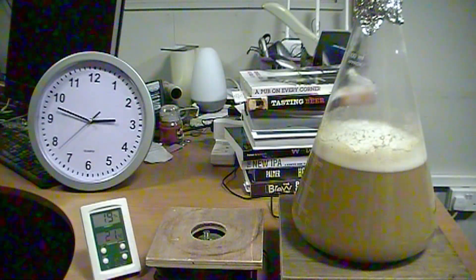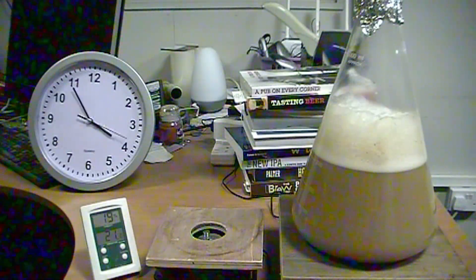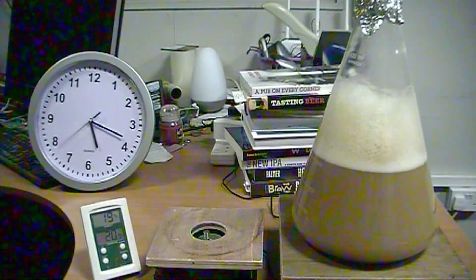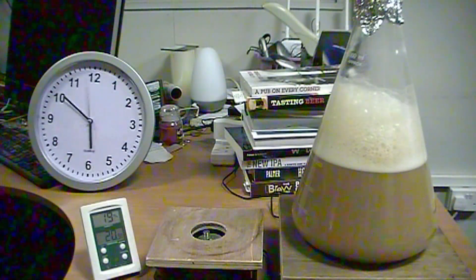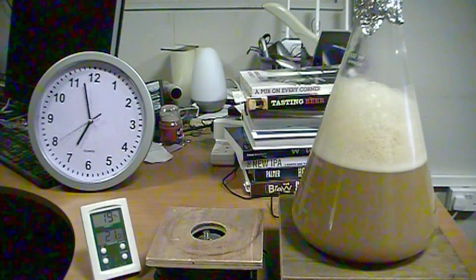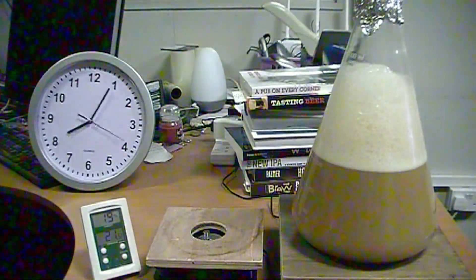The crucial thing I found with this really is to try and keep the temperature stable. Unfortunately, the air conditioning in my office is broken and the temperature fluctuates quite a lot.